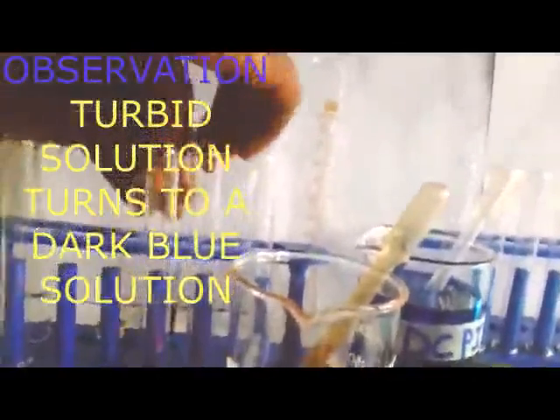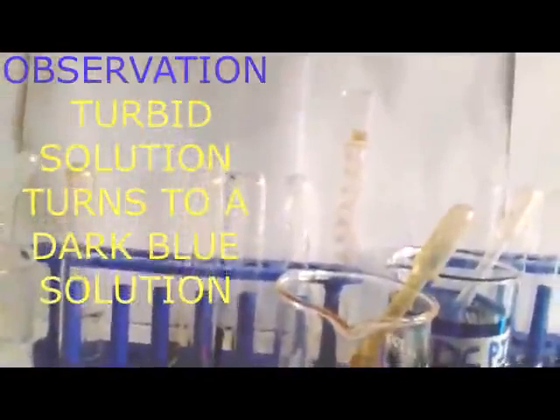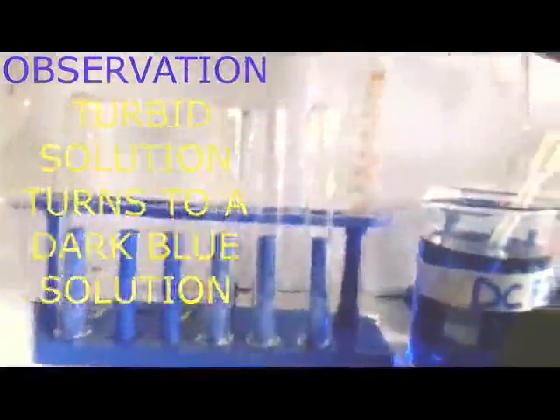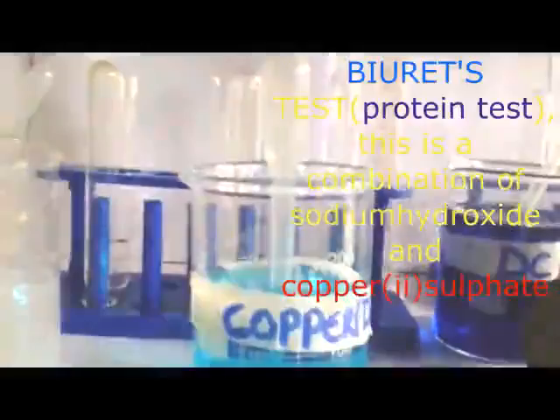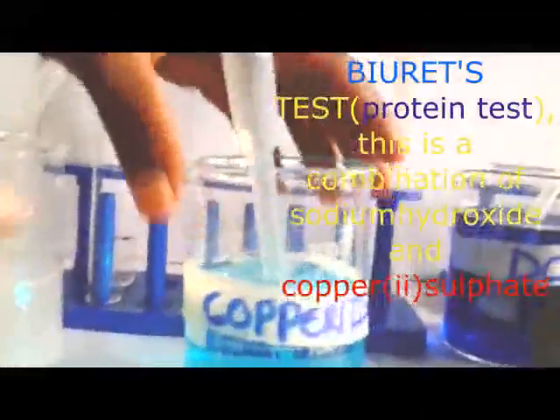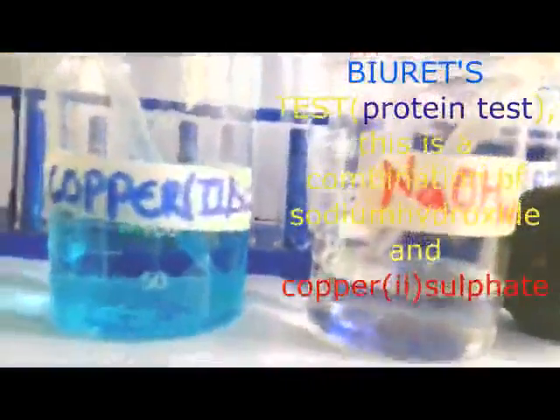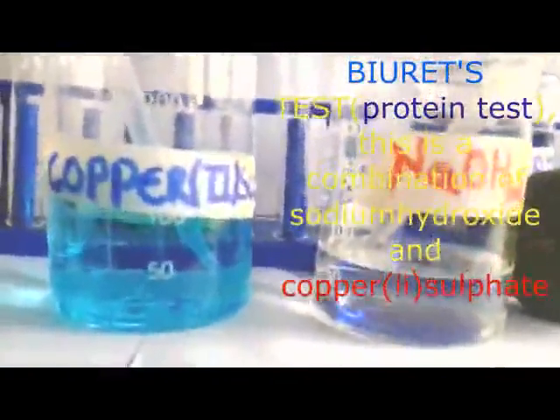Now members, when we put that one aside, our second test is going to be on what we call the proteins. Let me even put this one aside. Our proteins, we said, the common test is what we are calling the Biuret test. The Biuret test is a combination of copper II sulfate and another reagent which we are calling sodium hydroxide. So when you bring the two, they will give us the test which we are going to talk about.